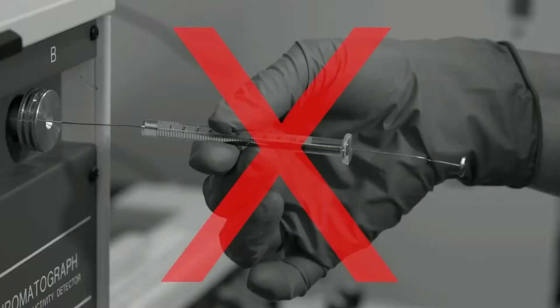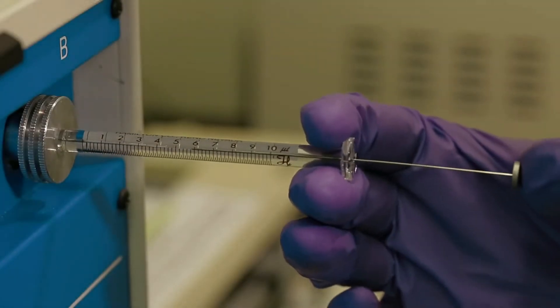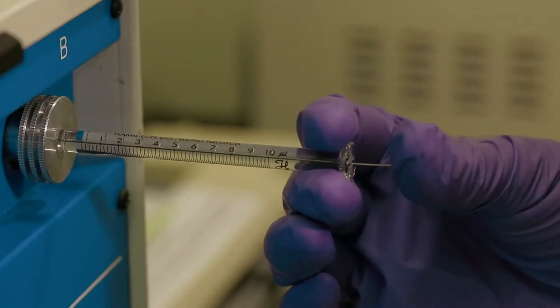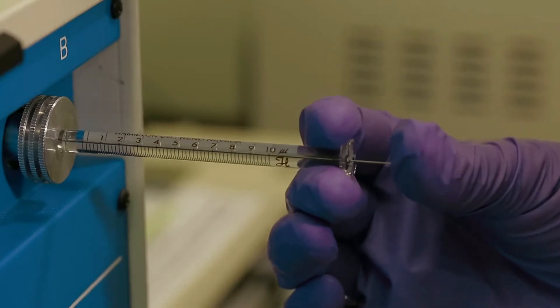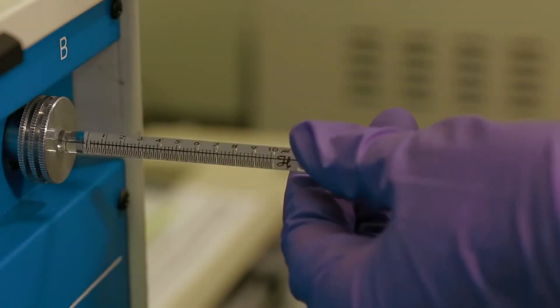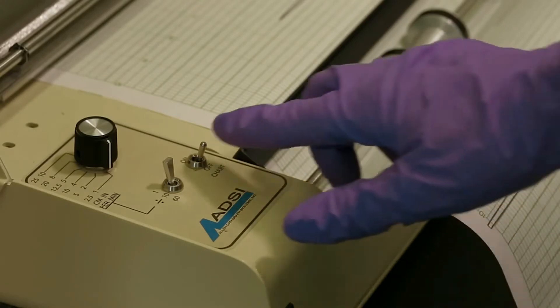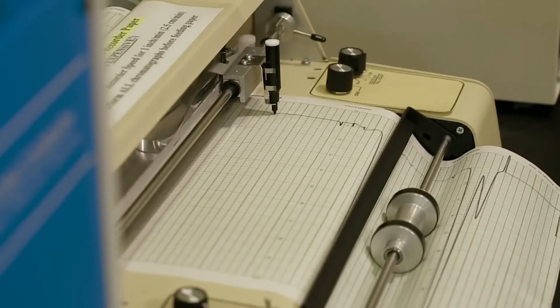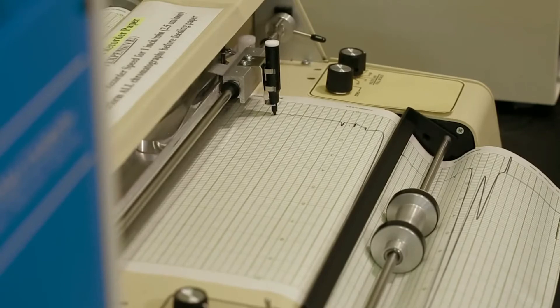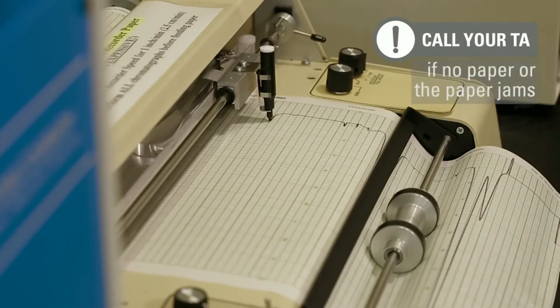Be careful not to bend the syringe. You can now inject your sample into the gas chromatograph. When you inject your sample, make sure to promptly plunge the syringe without bending it. It is necessary to ensure that the entirety of the sample is injected at one time. At the same time you inject the sample, turn on the chart recorder and make sure it is recording by checking the chart paper feed. If there is no paper or the paper jams, contact the TA for assistance.